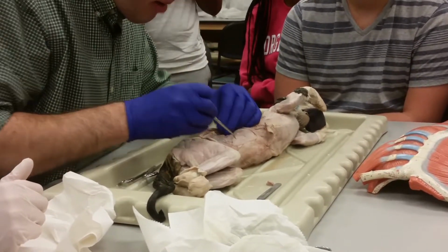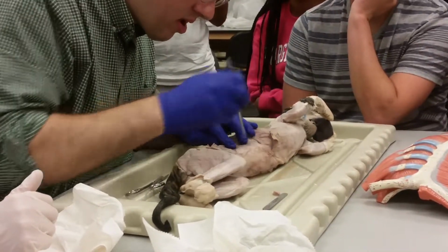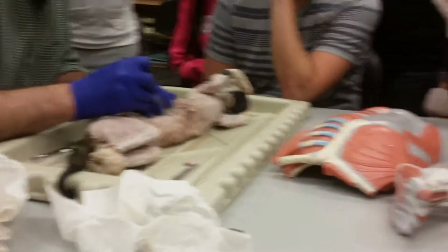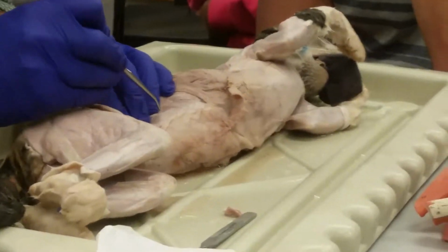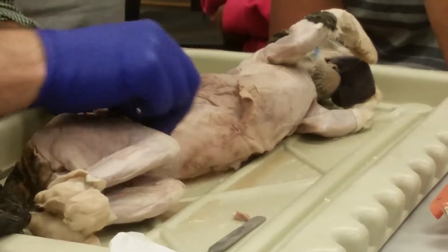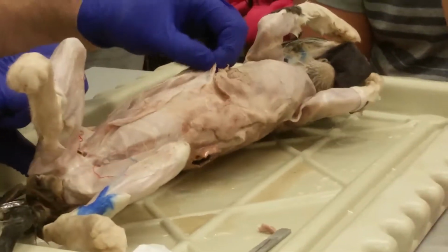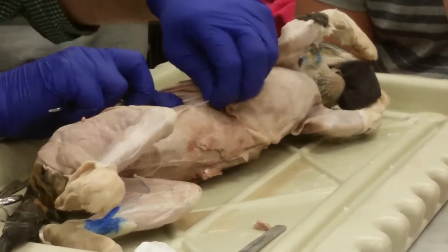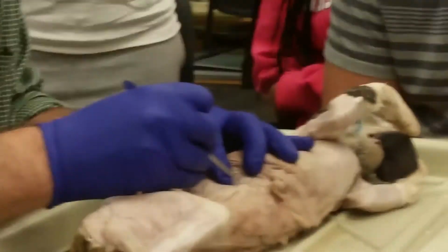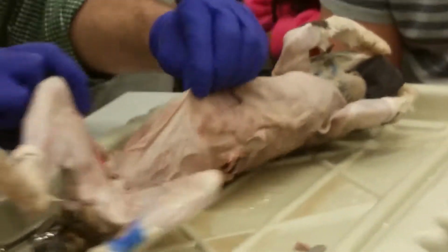Okay? Now, I've been talking about the rectus abdominis this whole time. It's over here. Get it separated out. It's not nearly as distinct on cats as it is on people. I think sometimes if I go all the way up to the top, I can get a good edge on it. Not even to it yet.